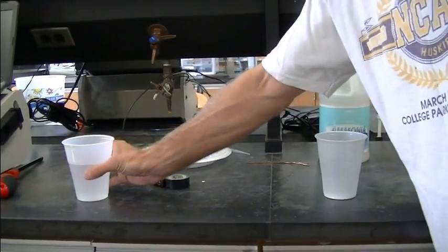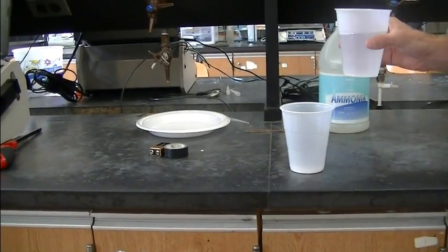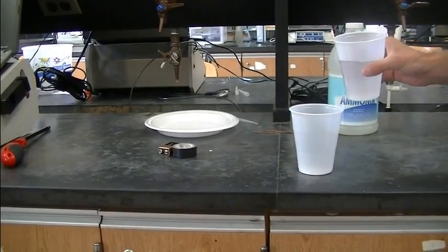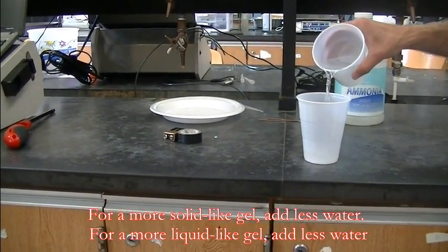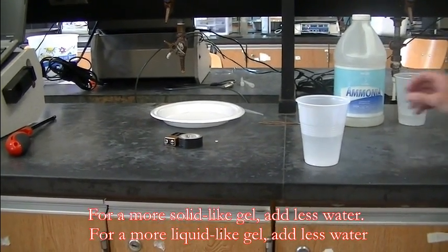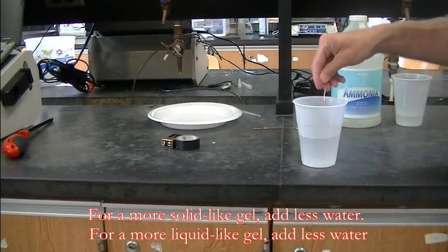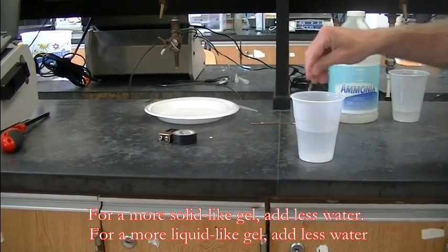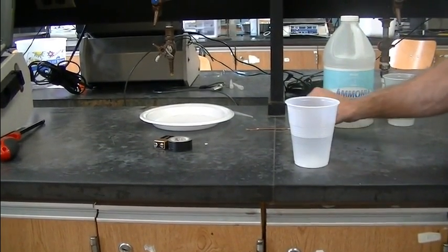And it looks like there's a little bit of cotton left over, so I'm just going to kind of extract a little bit more of the cotton. And I'm pretty sure all I have left are the sodium polyacrylate crystals at this point. Now I'm going to take some of this water, this is deionized water, but you can use distilled water that you buy from the grocery store, and I'm going to pour that in to this cup here. I'm going to pour it about half full. And I'm going to just stir it with one of my copper electrodes I'm going to use later. And this needs to be let set undisturbed for 15 minutes.